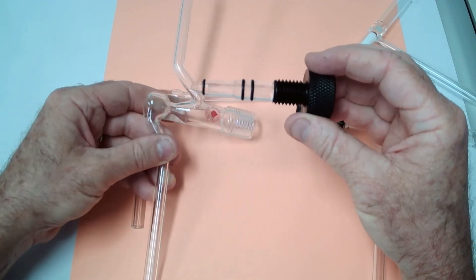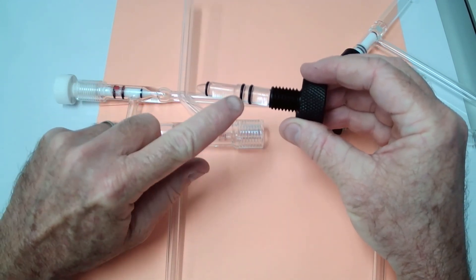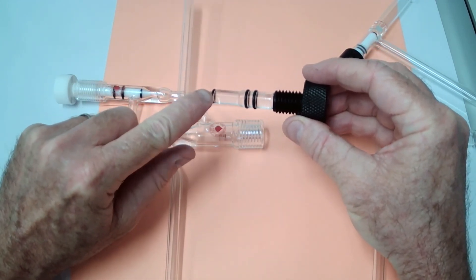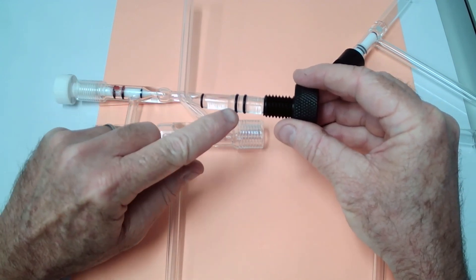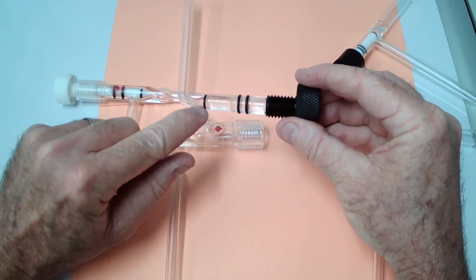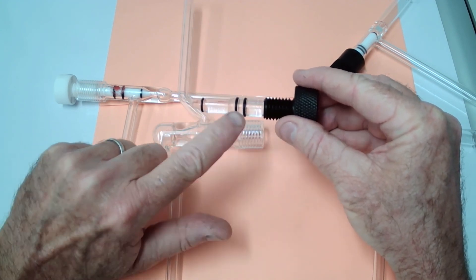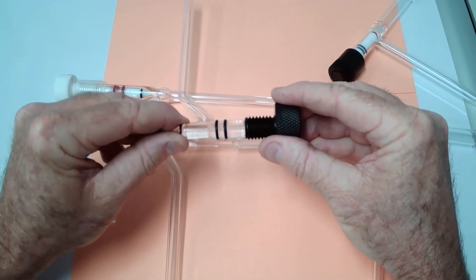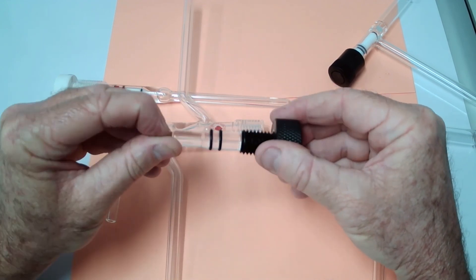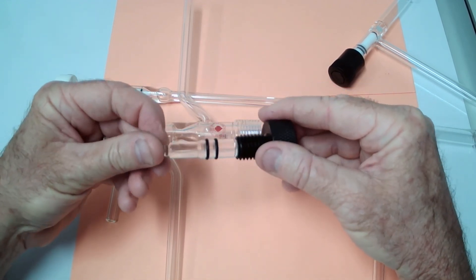You can replace any of these O-rings with O-rings of different materials. Just identify the size. Looking in the catalogs, they do actually sell kits that will give you all the O-rings that you can use to replace them with a compatible material O-ring.